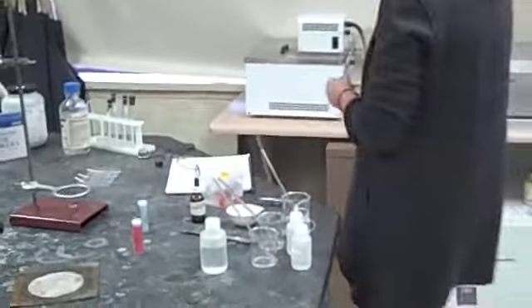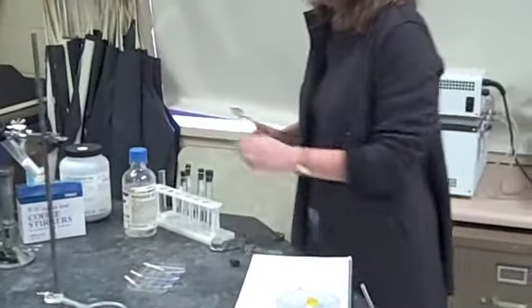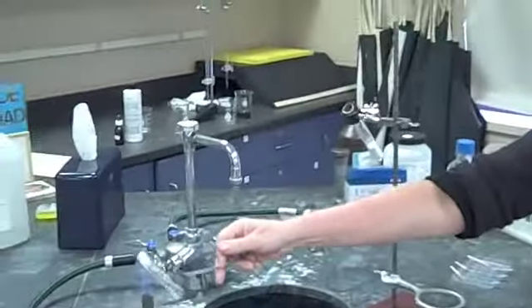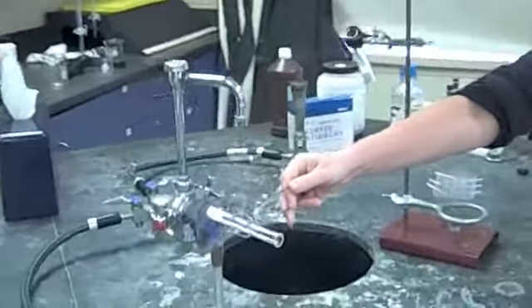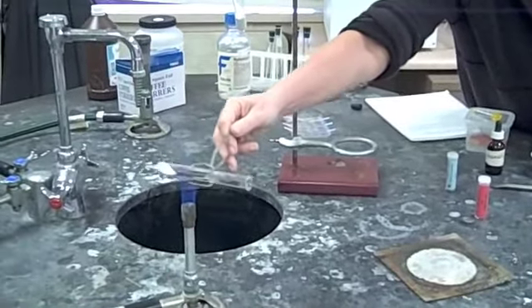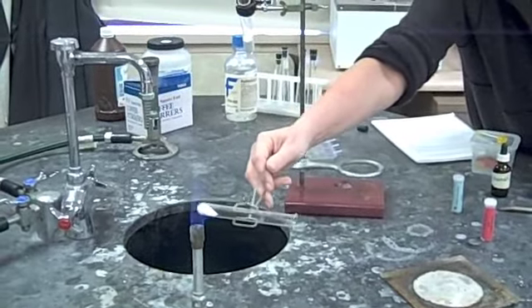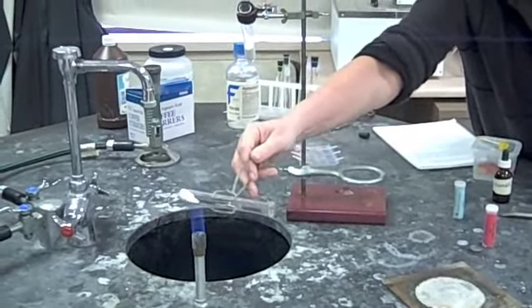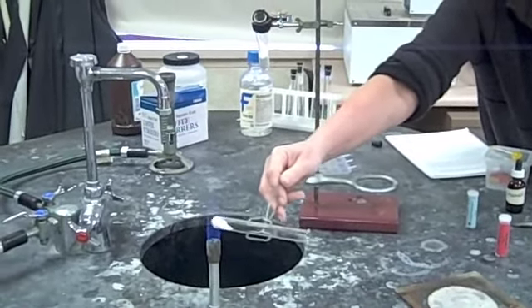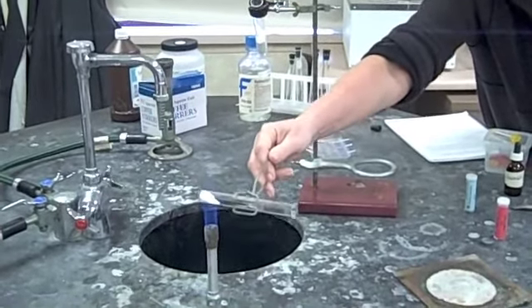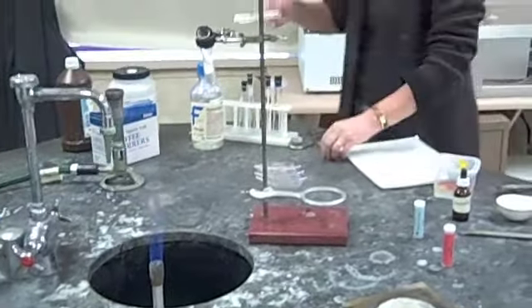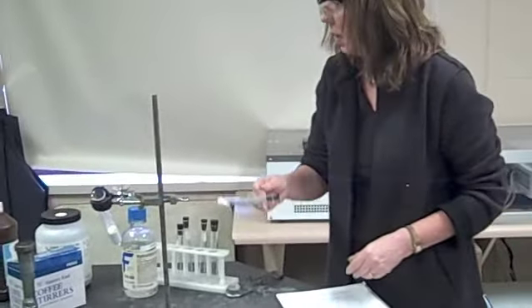The next thing that I want to point out is when they tell you to heat something horizontally in the flame, this is what they mean. You're going to hold it in and out horizontally in the flame, just like this. And you're going back and forth. And this procedure usually takes a little bit of time. You're going to have to be patient on that. And I'm not going to hold it there for the whole duration. I'm going to go ahead and put a stopper in it and we're going to look at that in a few moments.